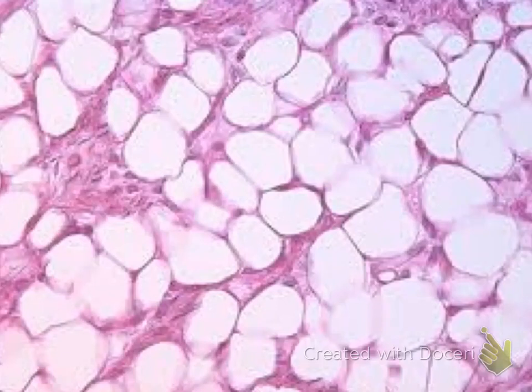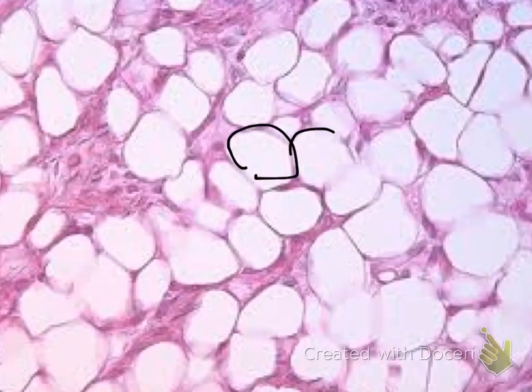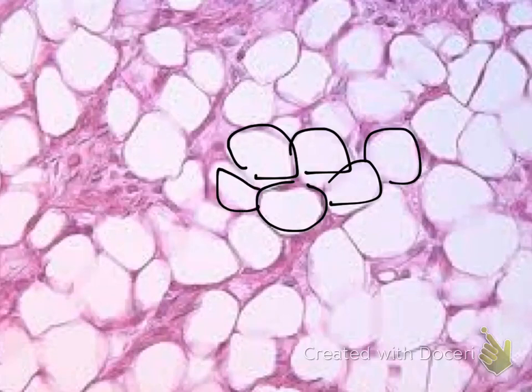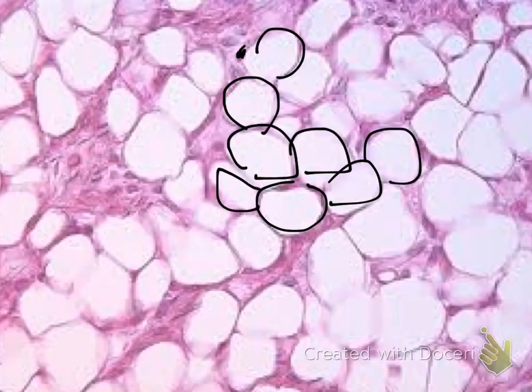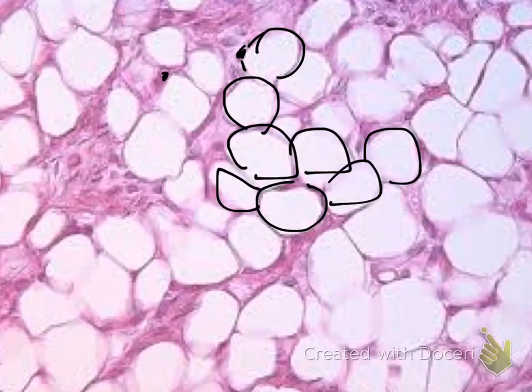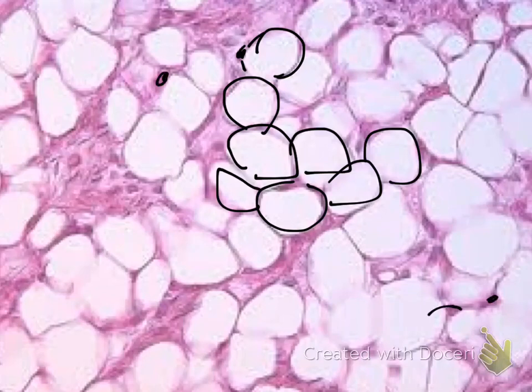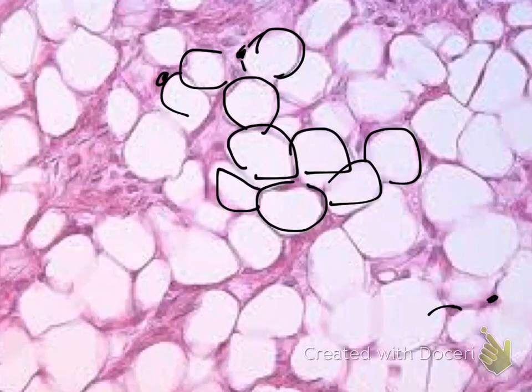Notice the appearance of these compartments. When you see these compartments, you are looking at adipocytes. The nuclei are pushed up to the side. These dark structures are your nuclei, and these are your adipose tissue.